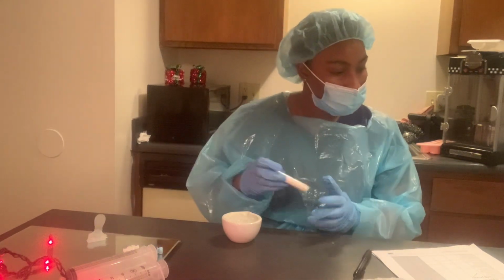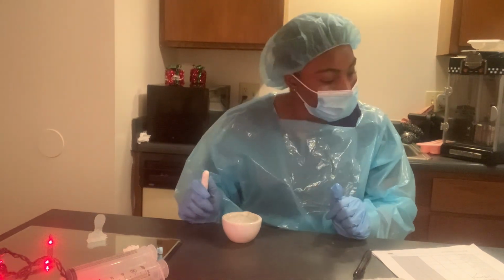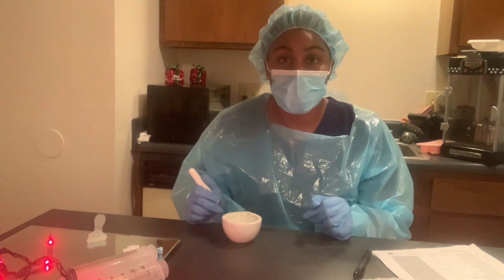Right, so now, that's called triturating. So we're going to triturate our testosterone and our gel base.